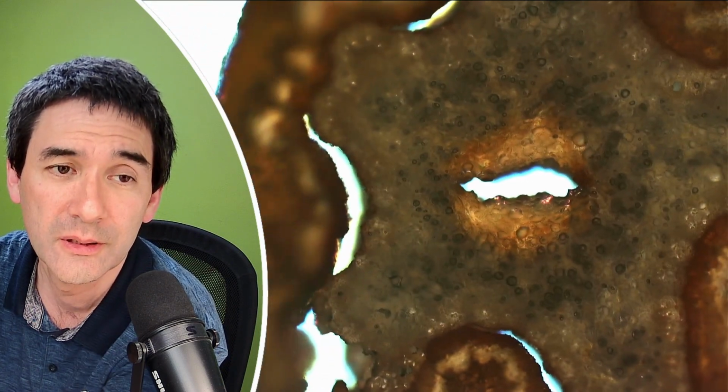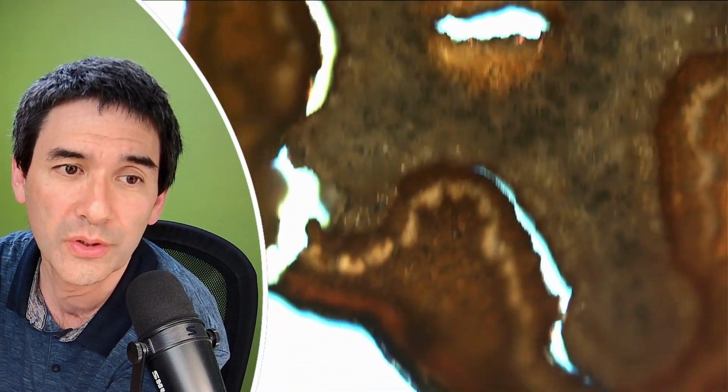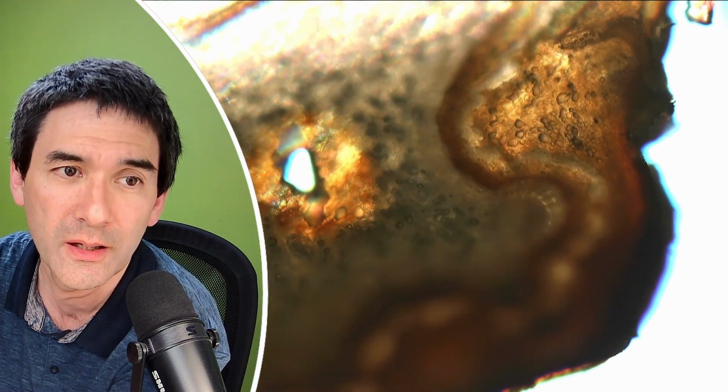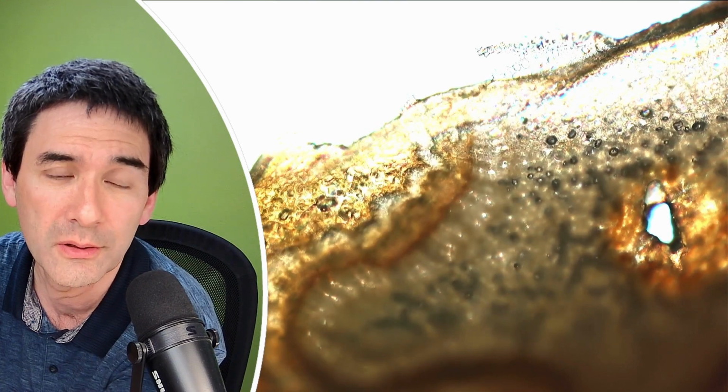The second one, this knife was already a little bit better. You can see over here that the individual cells are now a little bit visible already. And the specimen is also not quite as torn as the first one. This one over here is the barber knife. I've unfortunately cut it a little bit diagonally, so it's thicker down here and thinner up here.